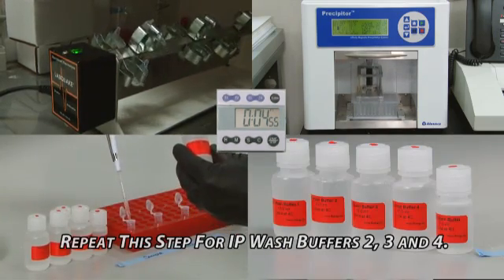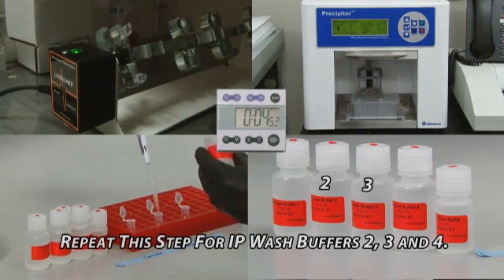Repeat this entire step for IP wash buffers 2, 3, and 4.